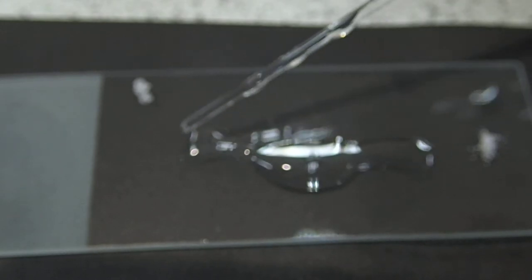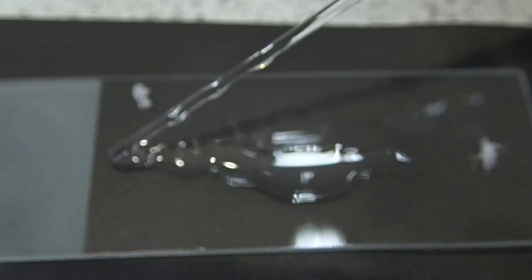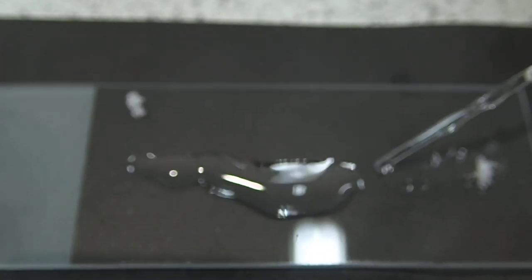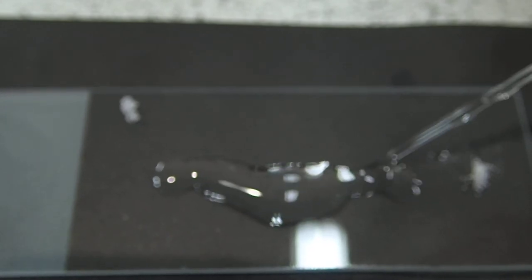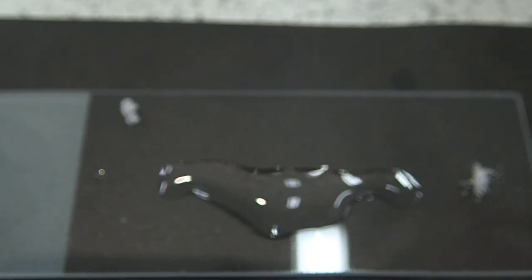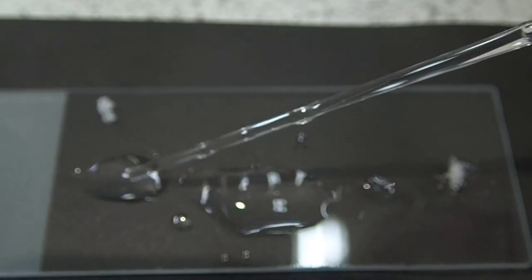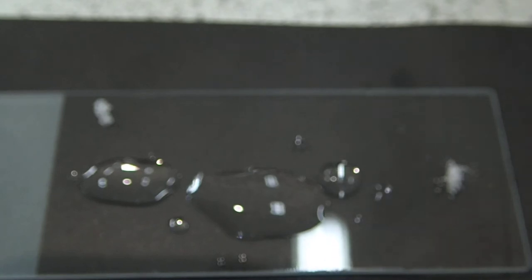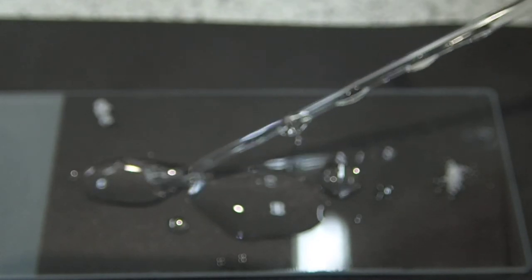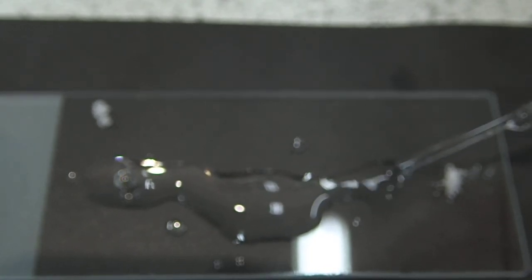I'll join them up there. The idea is, of course, we've got a length of water along which the material can diffuse — surface tension tends to bring it together in a droplet, but we should be able to get some kind of snakey shape. Let's take off some of that water at the bottom. We just want an elongated puddle. There'll be a dip at the bottom, but it still shouldn't totally ruin the experiment.